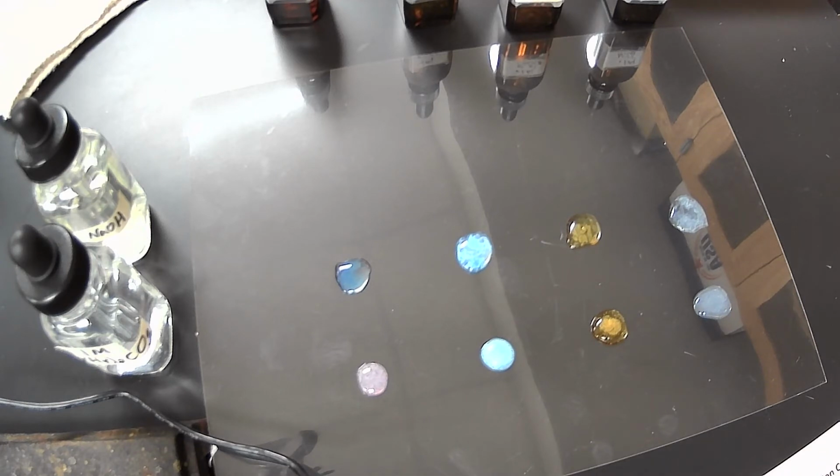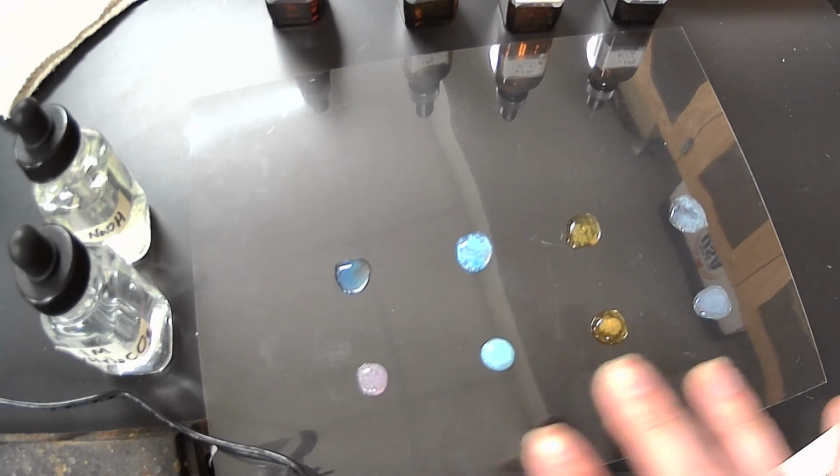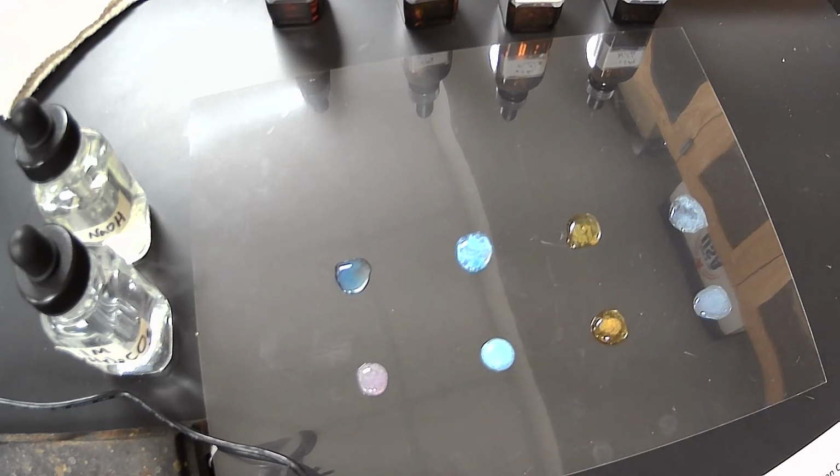All right. So for each one, we noticed our color changes. Okay, odor or gases given off, there's really not much of an odor for these. And then the formation of a precipitate. So yes, each of these do form a precipitate. And that is the cloudiness that we are seeing there.